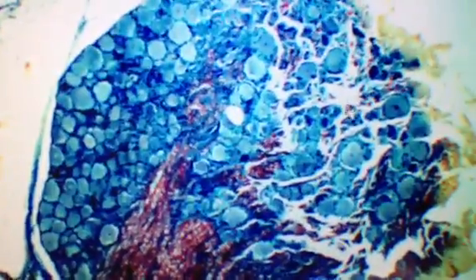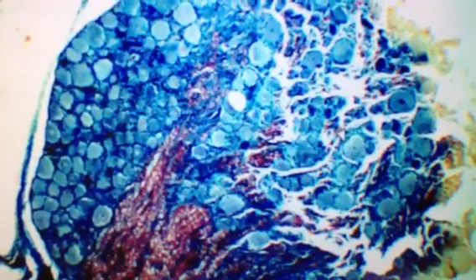Continuing dorsally from ventral, at the top we reach the dorsal horn. Unipolar sensory neurons are feeding and supplying it from the dorsal root ganglion seen here. The unipolar sensory neuron cell body is a peripheral ganglion bringing information in on a converging pathway. This is a myelinated — myelinated by Schwann cells — unipolar sensory neuron pathway feeding along these pathways into the dorsal horn of the gray matter.